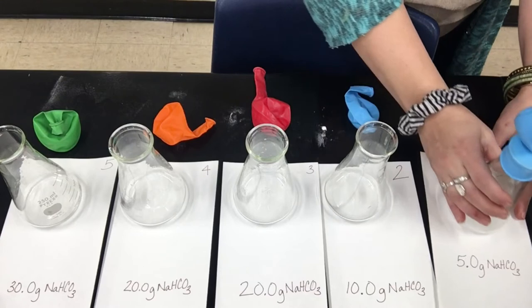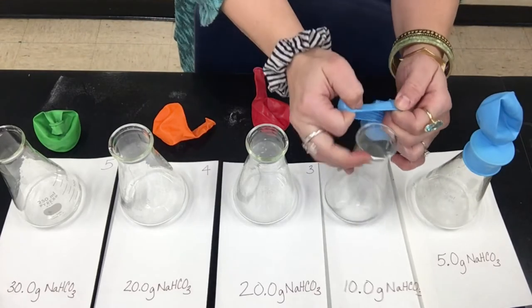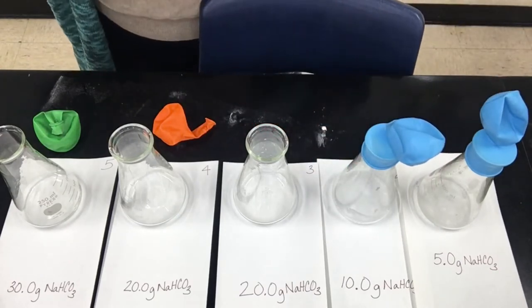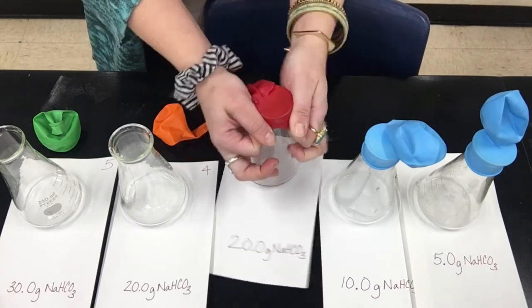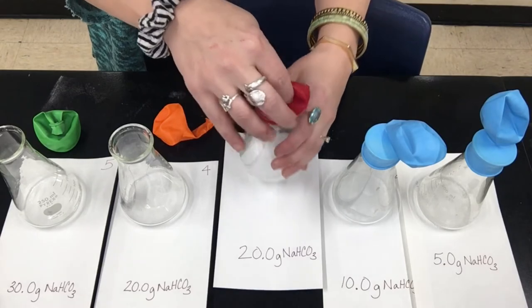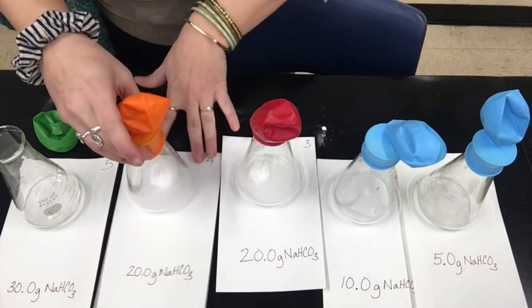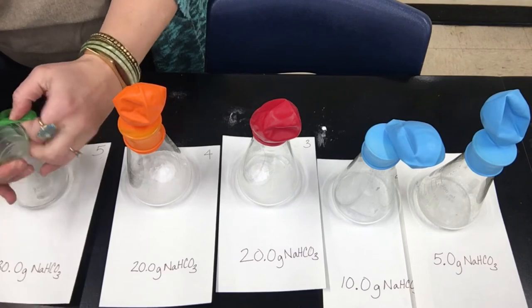I'll empty the baking soda and we'll wait for that to react. Our first Erlenmeyer flask contained 5 grams of baking soda or sodium bicarbonate. Our second flask now contains 10 grams in addition to the 20 milliliters of acetic acid or vinegar. My third flask contains 20 grams. Flask 4 has 20 grams of sodium bicarbonate or baking soda. And finally, flask 5 has 30 grams of baking soda.